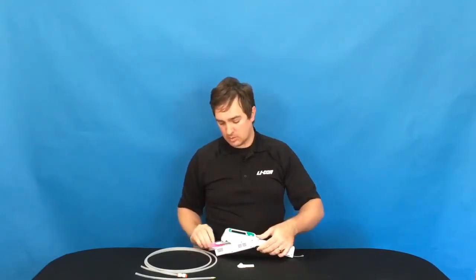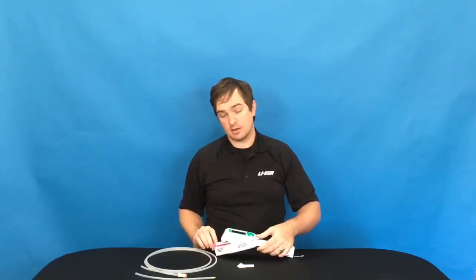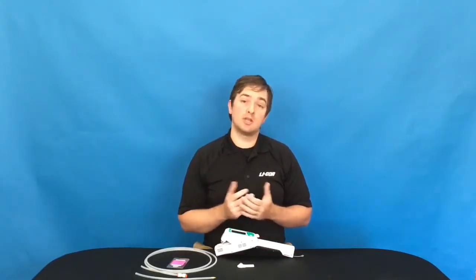You will also need a piece of plastic or laminated paper to clip into the instrument to ensure that we get a good seal and that flow gets to both relative humidity sensors. Let's get started.